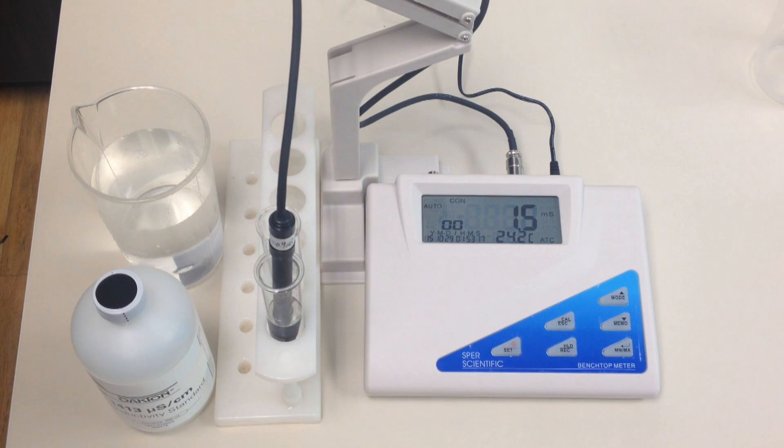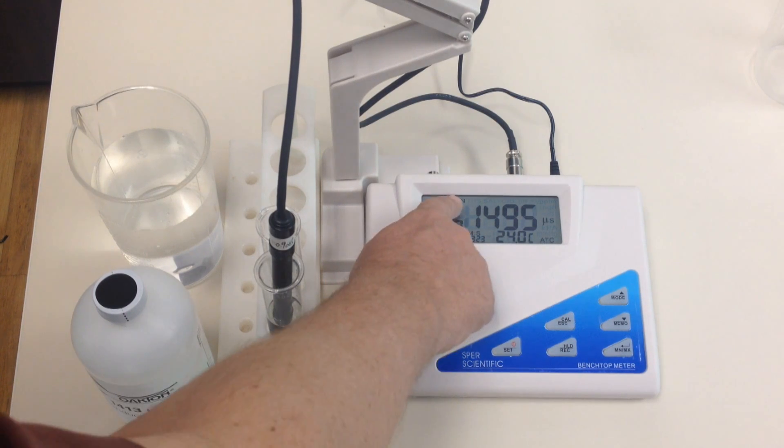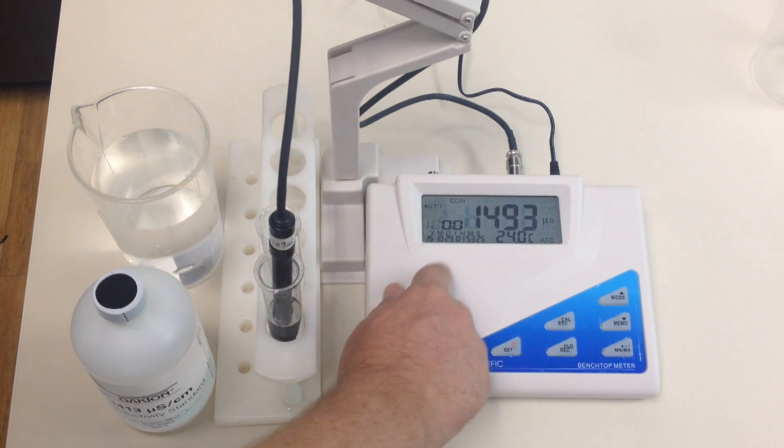First thing you're going to want to make sure on the nice big screen here is you're in conductivity, because these meters do more than just one parameter. So we are in conductivity and we're in auto calibration.